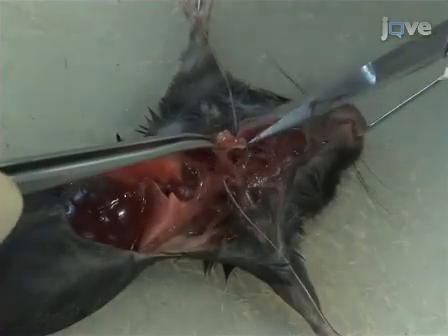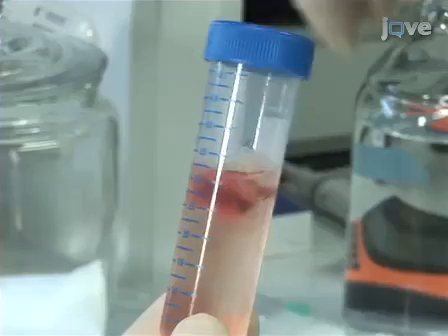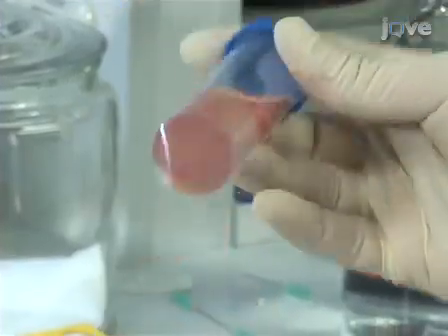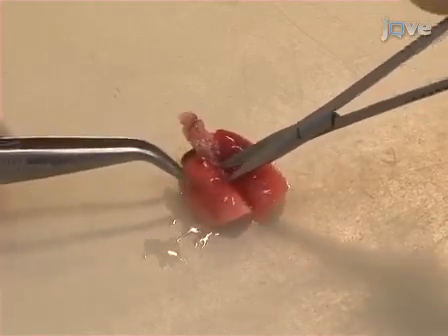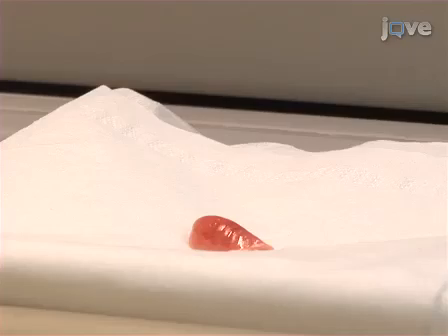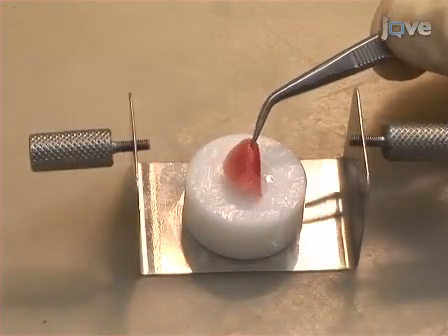After the agarose has solidified, beginning from the trachea, excise the whole lung from the opened chest and wash it with the pre-cooled PBS. Using a pair of sharp pointed scissors, remove the right lung lobe. Briefly dry the bottom of the lobe on a sheet of tissue paper, and then fix the lobe to a vibratome preparation block using a drop of tissue adhesive for 1 minute.